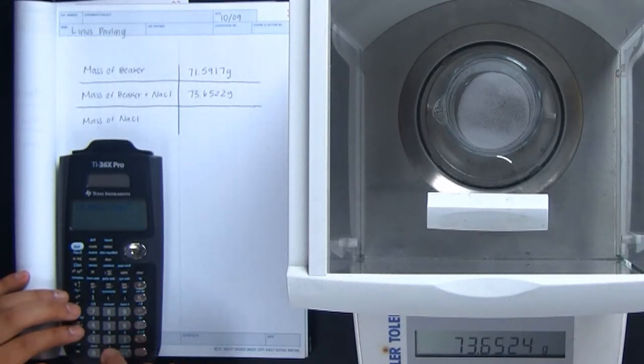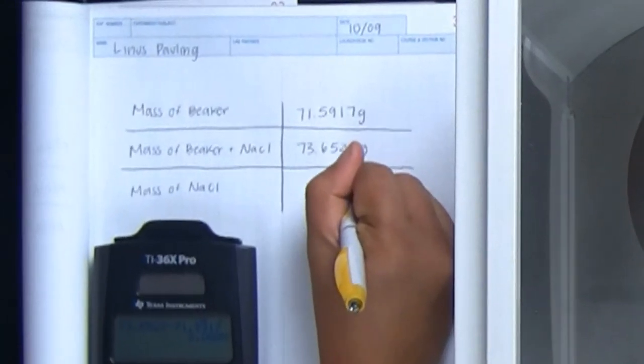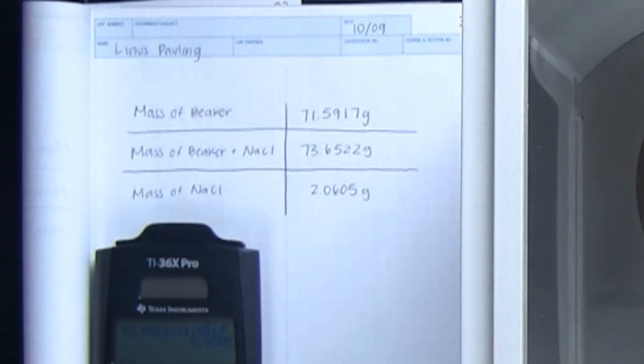Notice that Wendy has her lab notebook right at the balance. Always record your data directly into the lab notebook. Don't use scraps of paper or paper towels or any of the ways of recording data outside of your lab notebook.